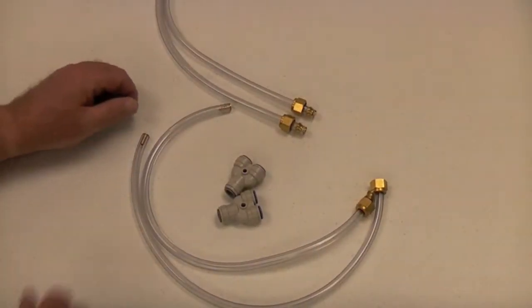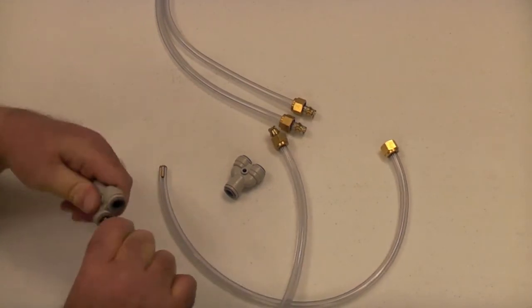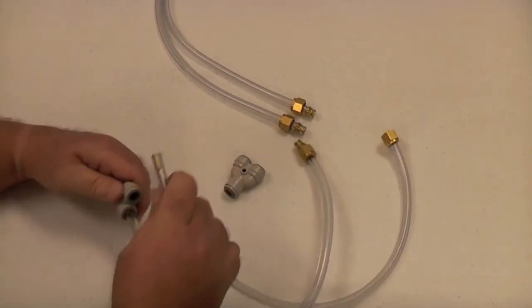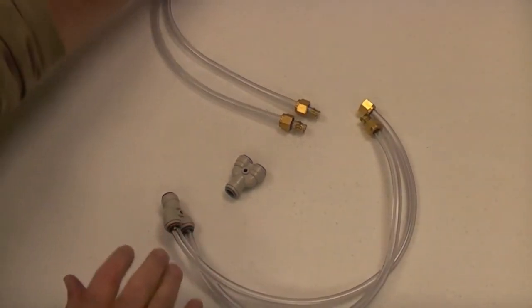Now, the opposite end of the four cut tubes can be inserted into the two-way divider fittings. Push the tubes into the dividers with a moderate amount of force. The tube insert will barely be visible when inserted correctly.